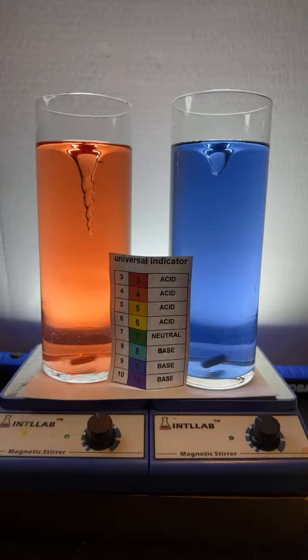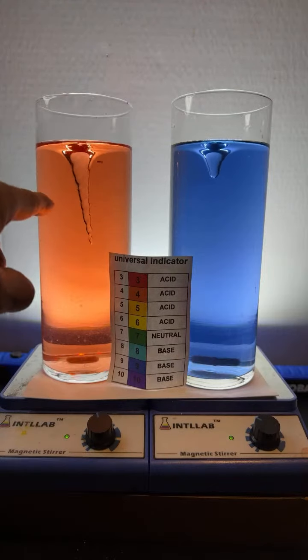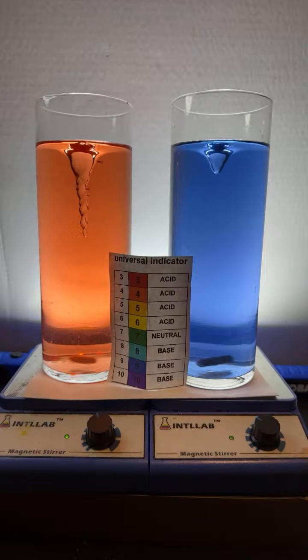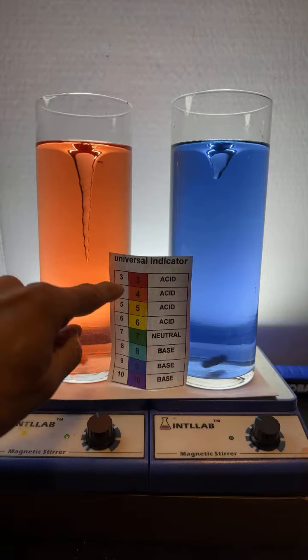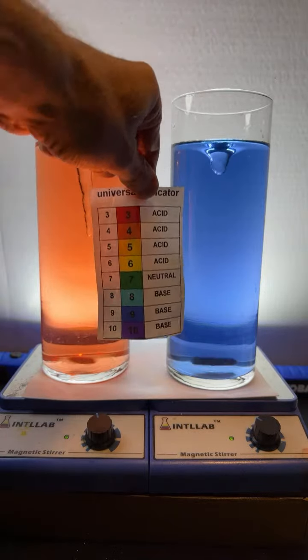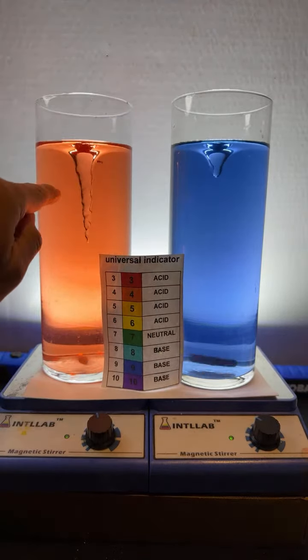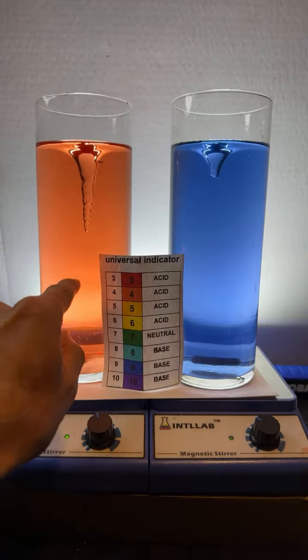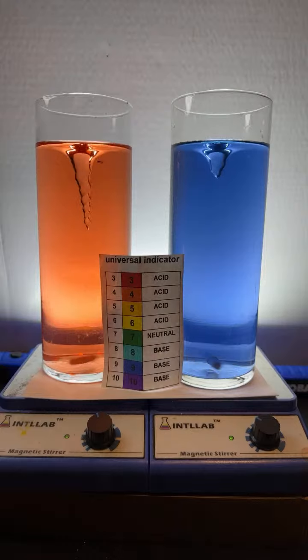All right, here we go. Sorry about that. I lost connection there for a second. So what I got here in the two flasks, I have some water. I've got some universal indicator. And you can see the different colors that universal indicator will display at different pH values right here. So you can see this flask over here. What's that, like pH 4? Yeah, it's orange. Over here, it's blue. At pH, I'm going to call that 8 or 9.